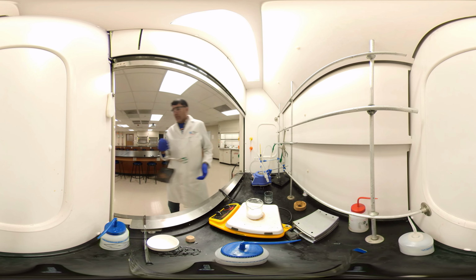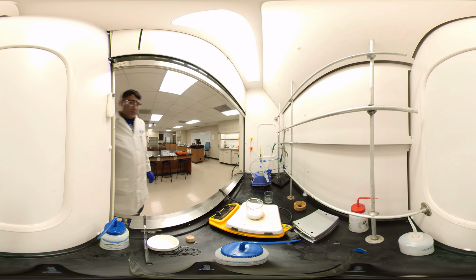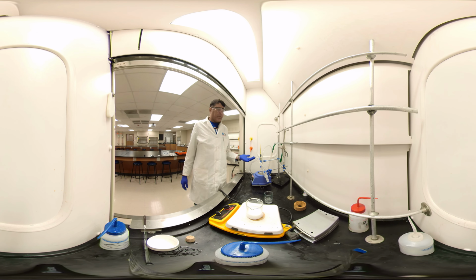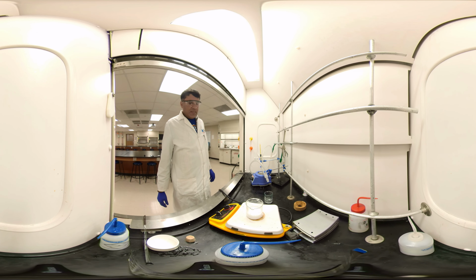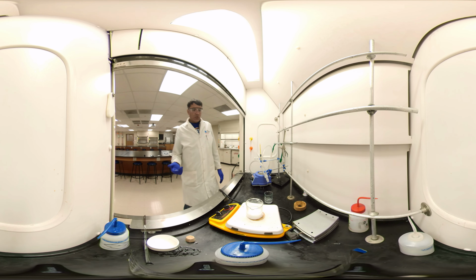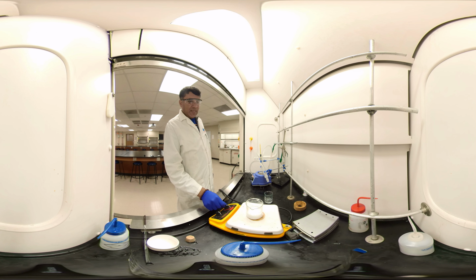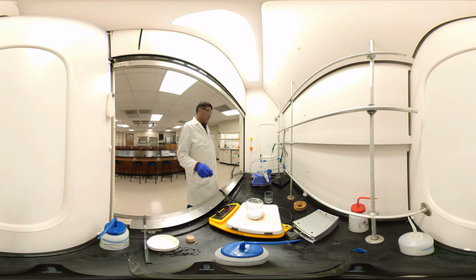I don't need this one right now. I can move it to the side. So in one place, we are removing solvent from benzyl alcohol. In the other place, we are recrystallizing benzoic acid. We keep heating until it dissolves. Then I'll show you when it dissolves. If it does not dissolve or the water is not enough, when it's hot or boiling, then add water slowly. What you can do is put water in a beaker on the side and keep adding the hot water slowly. And turn off for a while.